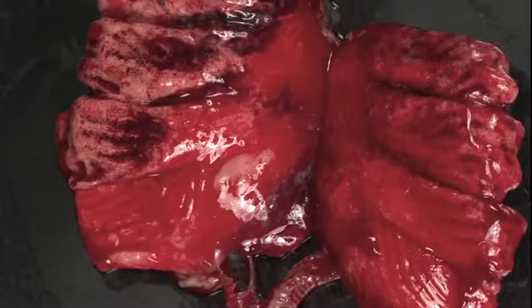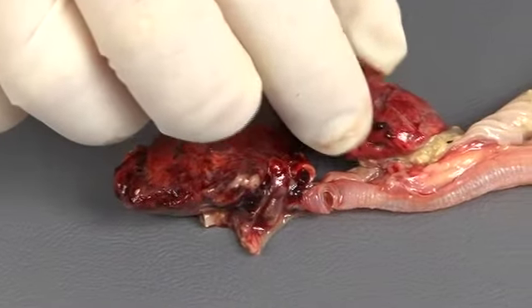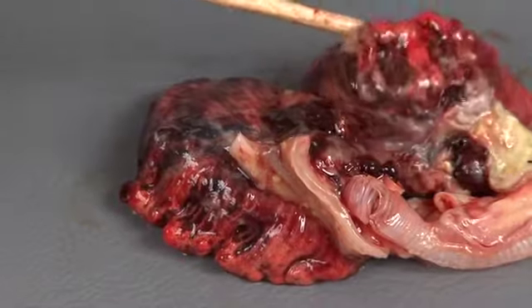The healthy lungs of a fresh bird should be pink. However, as the post-mortem interval increases, the lungs will become progressively darker due to congestion. Gently palpate the lungs without crushing them. Normal lungs should feel slightly spongy. Firm areas within the lungs indicate pulmonary disease.